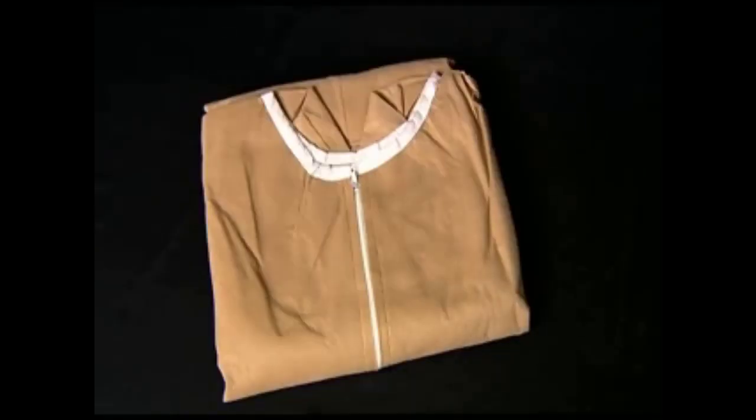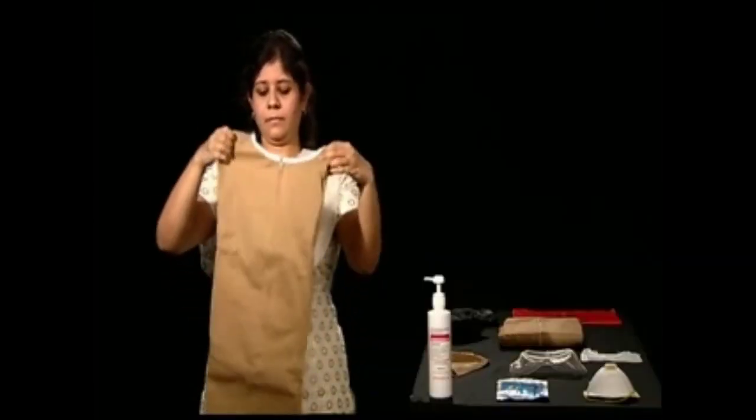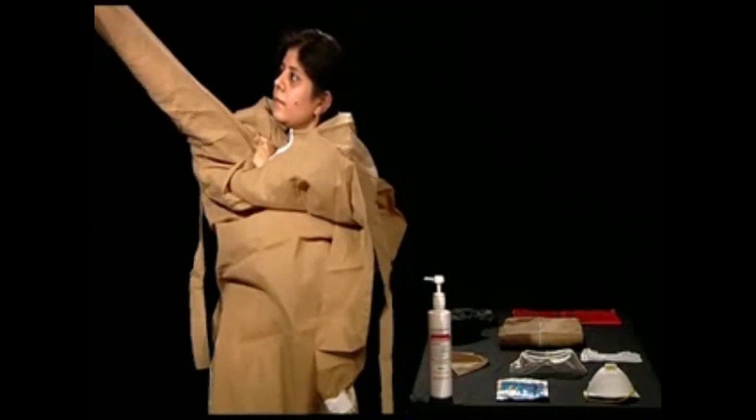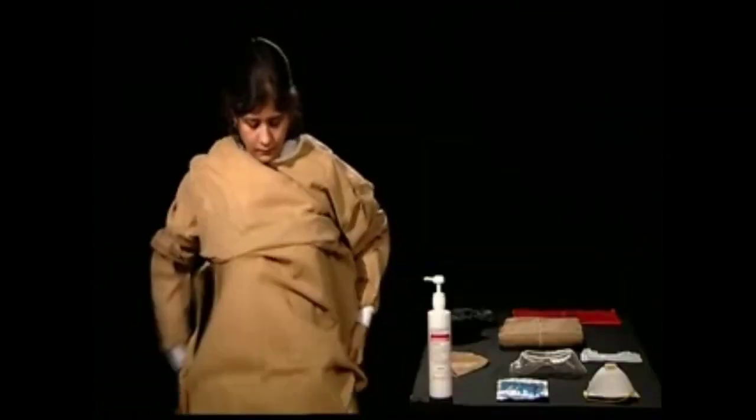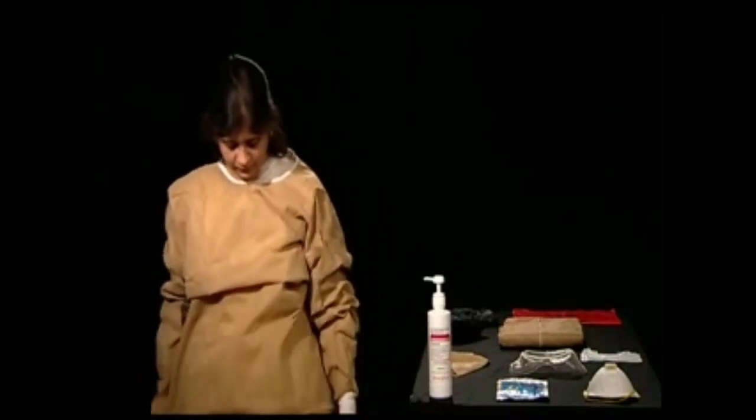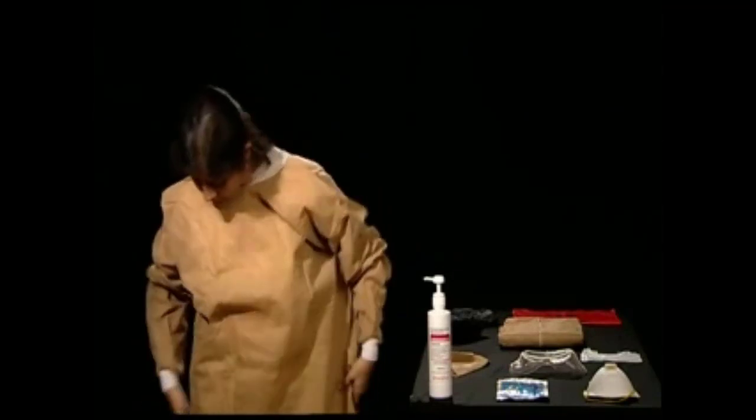Unfold the gown and roll it over your head. Using your hands, zip up the body gown and tie the strings behind your back.